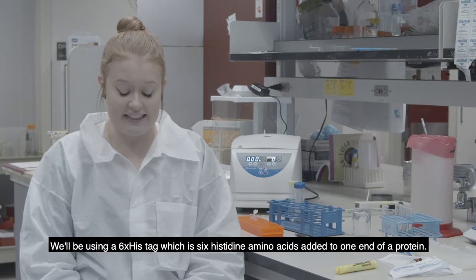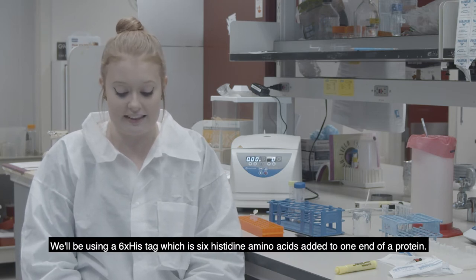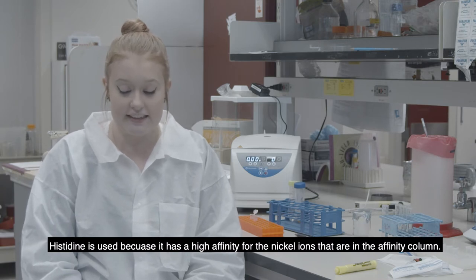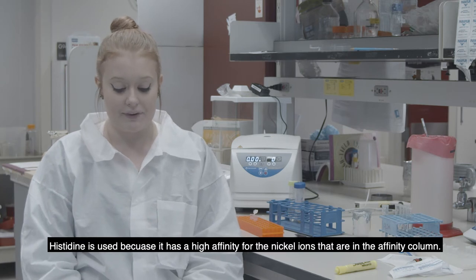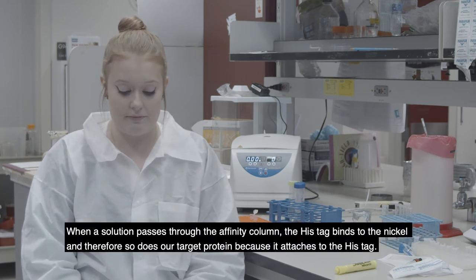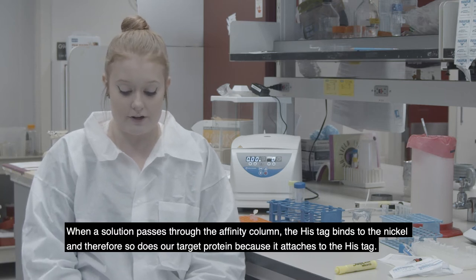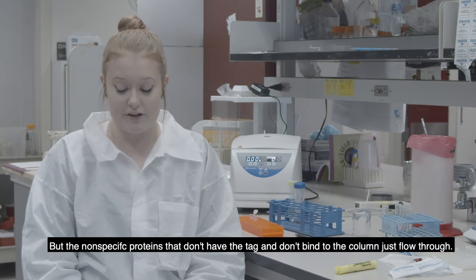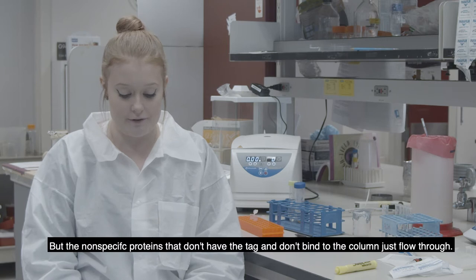We will be using a 6X histidine tag, which is 6 histidine amino acids added to one end of our protein. Histidine is used because it has a high affinity for the nickel ions that are in the affinity column. When the solution passes through the affinity column, the His-tag binds to the nickel, and therefore so does our target protein because it's attached to the His-tag. But the non-specific proteins that don't have the tag don't bind to the column and just flow through.